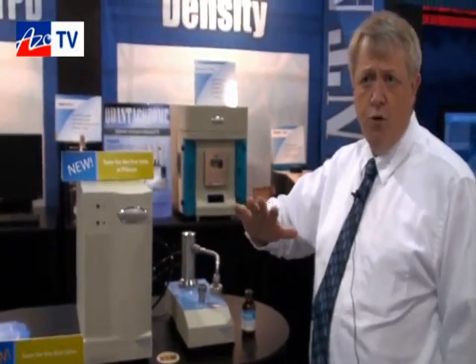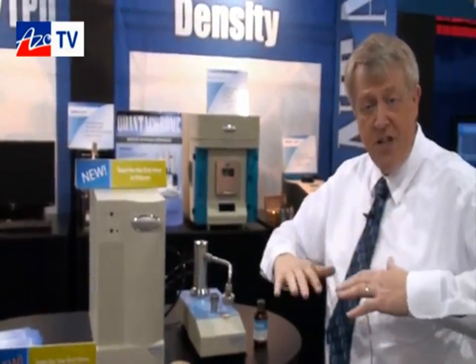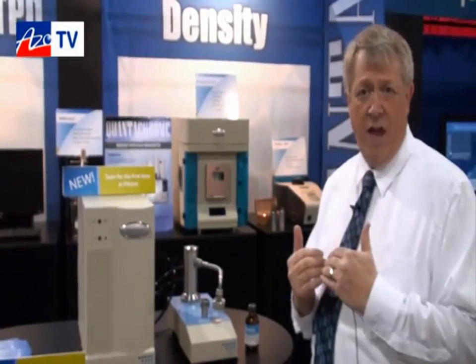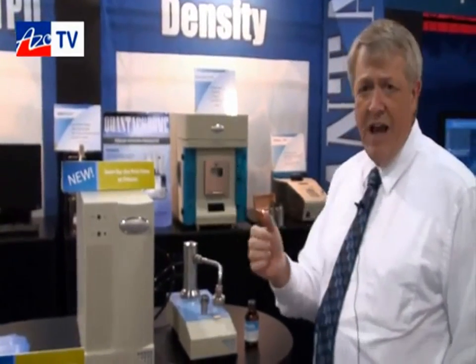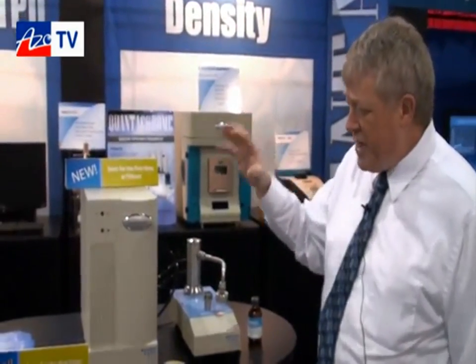So the largest pores will empty first at the lowest pressure, and when those pores empty, there's a resulting airflow through those pores. The number of pores that empty will increase that airflow at that pressure. So on board we have very fine control of applied pressure and measurement of resulting airflow. Now that airflow, as all of the pores empty, can be quite considerable, up to tens or hundreds of liters a minute.